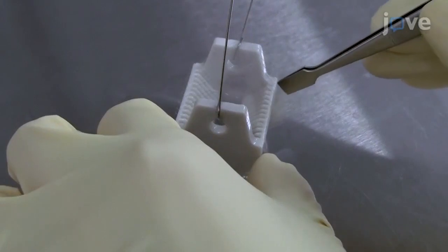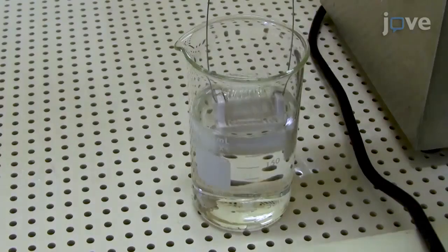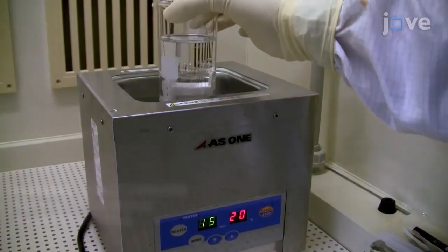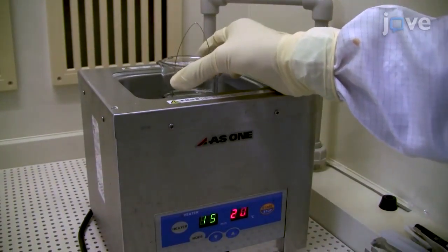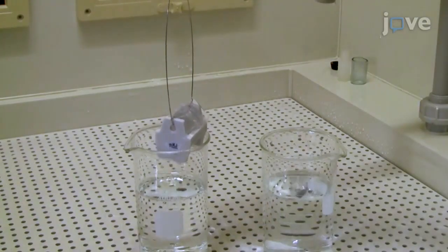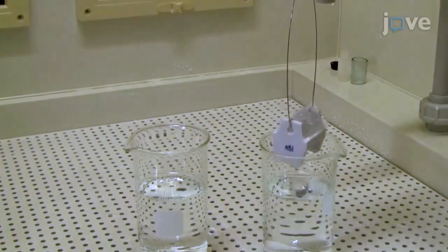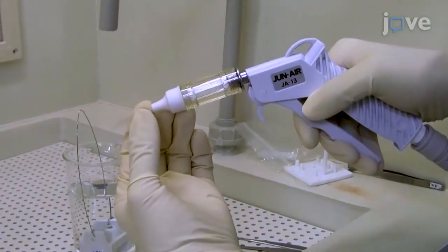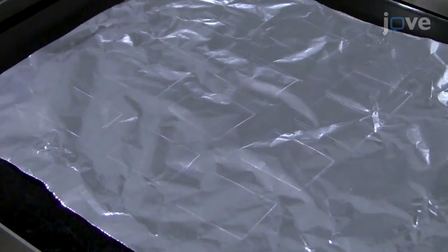To begin, set a cover glass on a staining rack and place the rack in 8 molar sodium hydroxide. Sonicate the cover glass and staining rack for 15 minutes at room temperature. Remove the staining rack from sodium hydroxide and rinse the cover glass with water 10 times. Dry the cover glass with an air gun. Then bake and dry the cover glass on a hot plate at 200 degrees Celsius for 5 minutes.